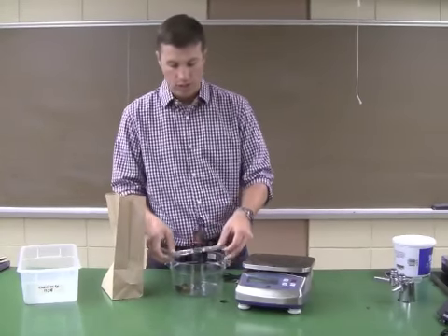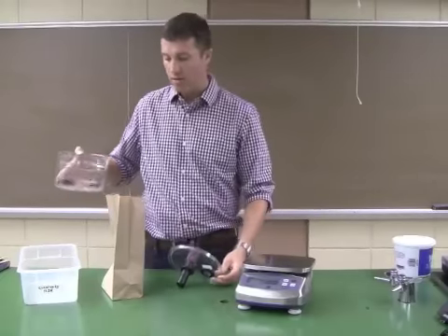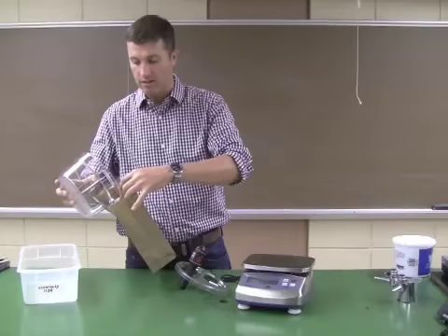And then when you're finished, you can take them out of the chamber, put them back in your weighing sack.